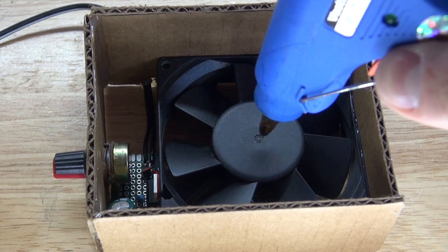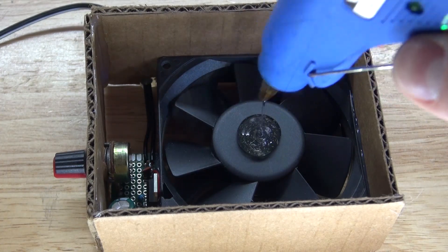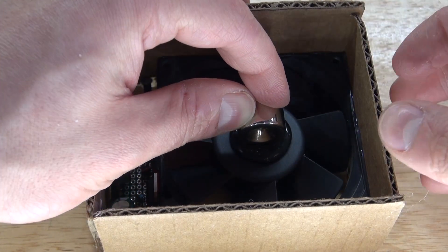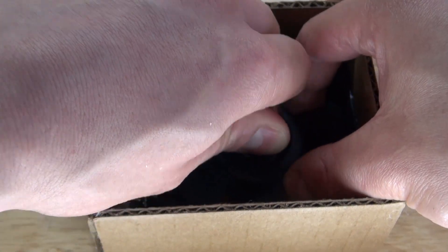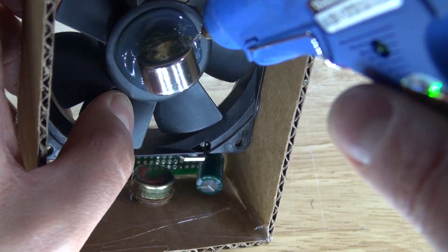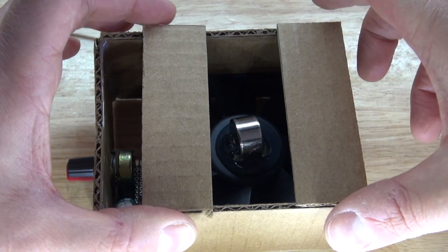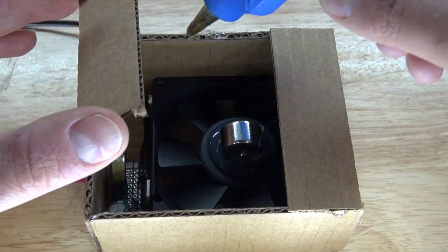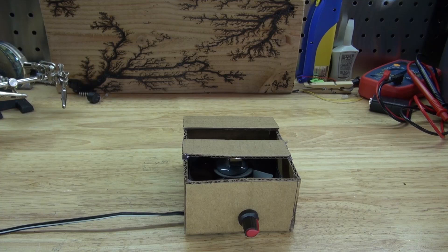Next I'm going to put a large amount of hot glue on the fan so I can place the magnet into place. The reason for the large amount of glue is to hold the magnet so it doesn't fall out — because when the fan is spinning, the magnet will slightly vibrate and could fly off. Make sure it's centered by adjusting it. Then I'm going to take the top panels, place them so the magnet is in the center, so I know where to put my beaker and stir rod. Glue it all into place, and there you have it — the project is now complete.